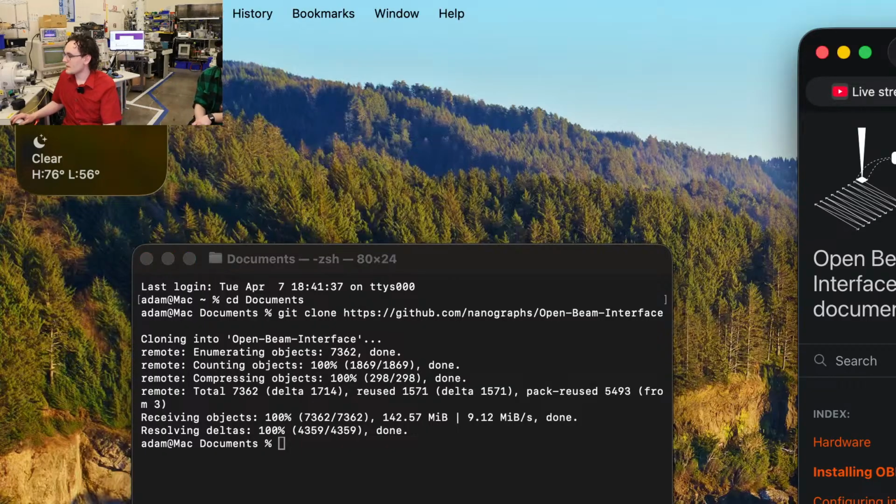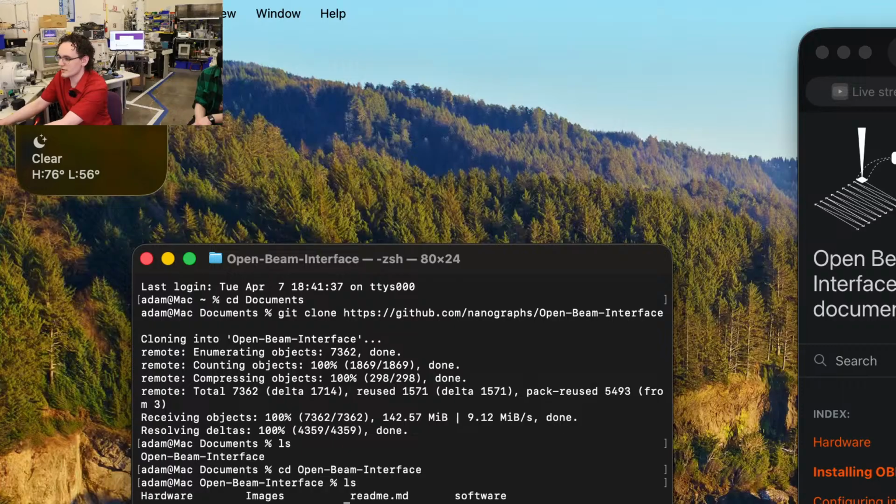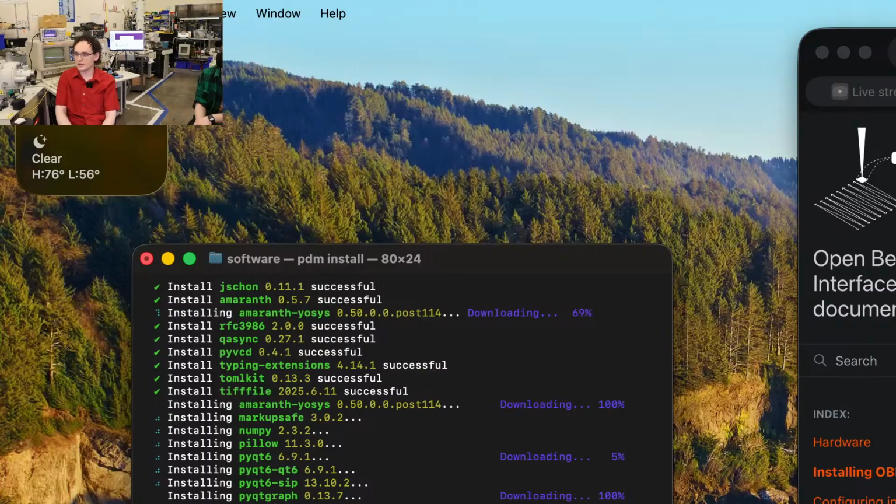So once we have the git clone done, if we do ls, we've got the open beam interface folder. Let's go into open beam interface. Once we're in here, we've got a couple of folders. The one that we're going to go to for now is software. So let's do cd software. Once we're in software, we're going to do pdm install. And that's going to pretty much take care of everything we need for open beam interface here.